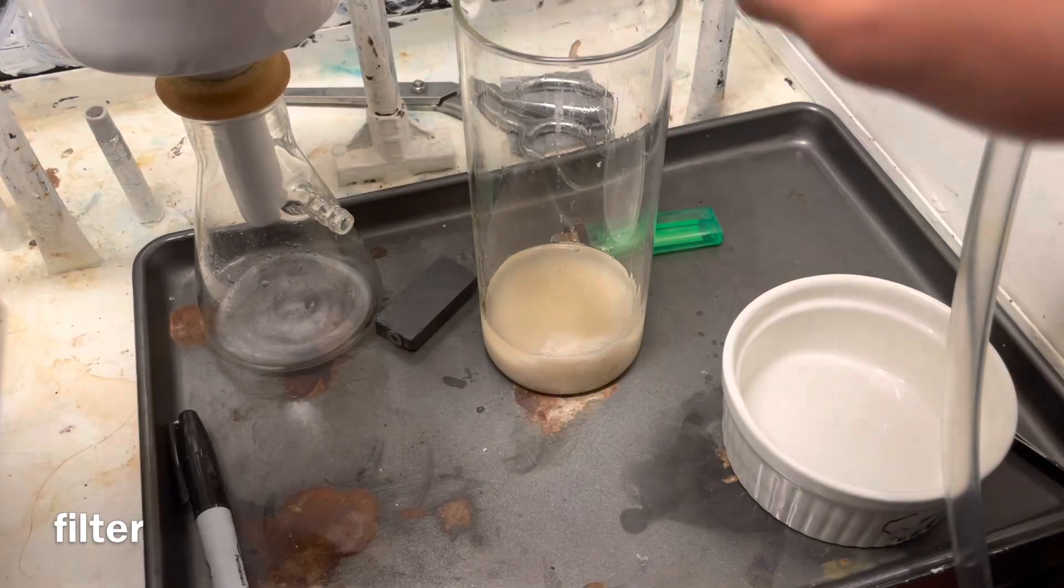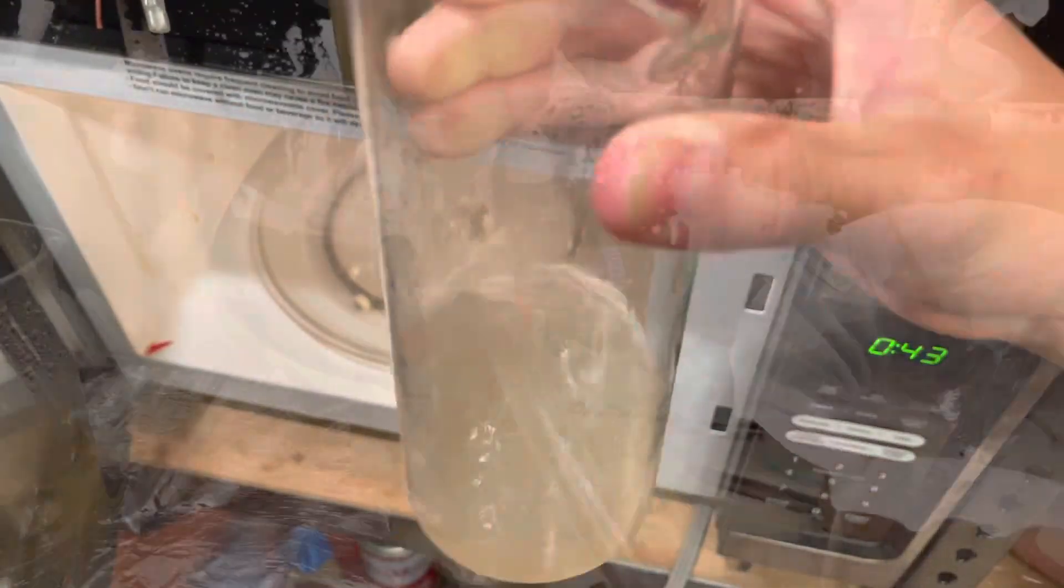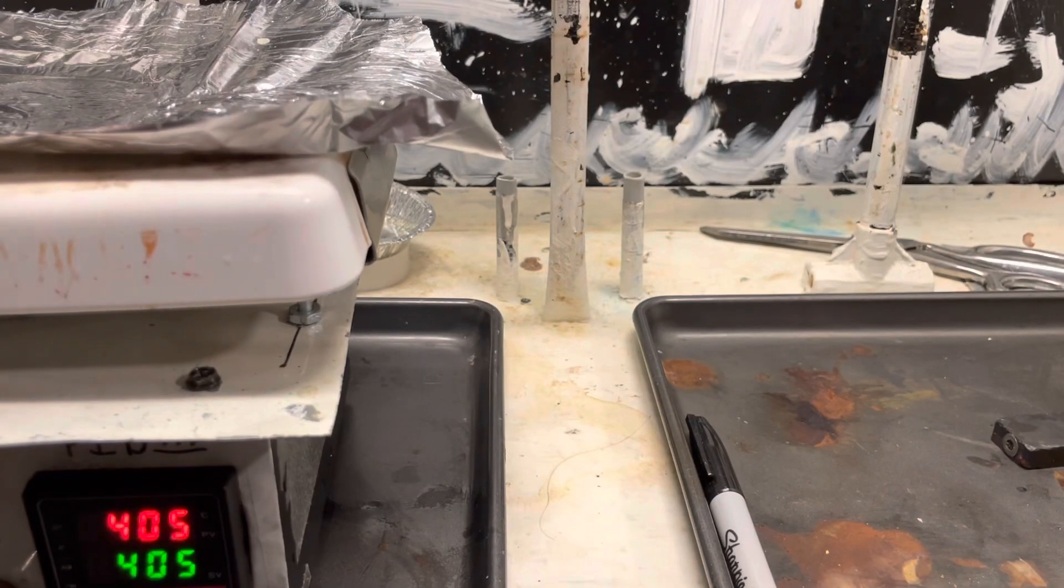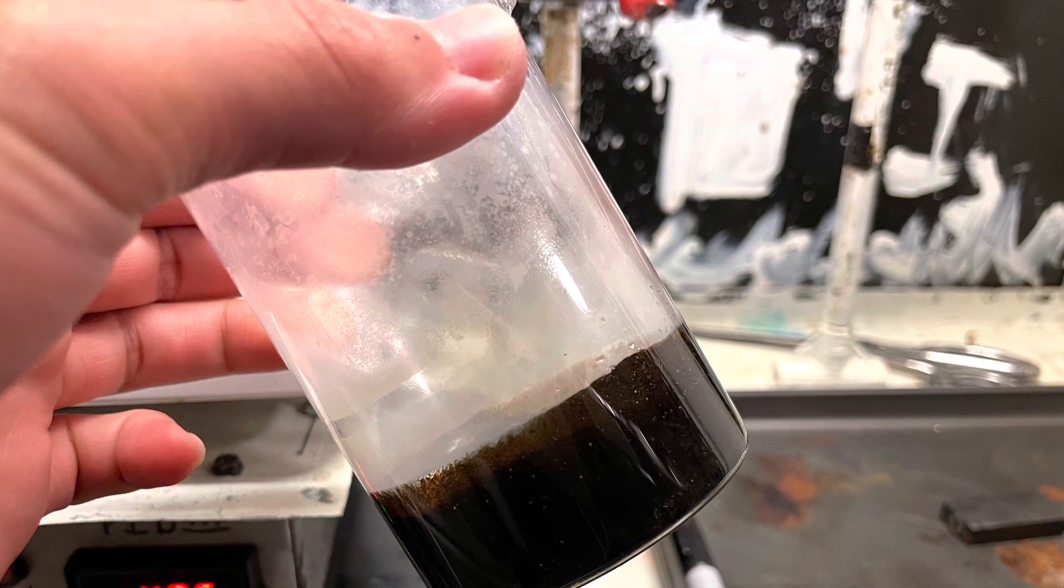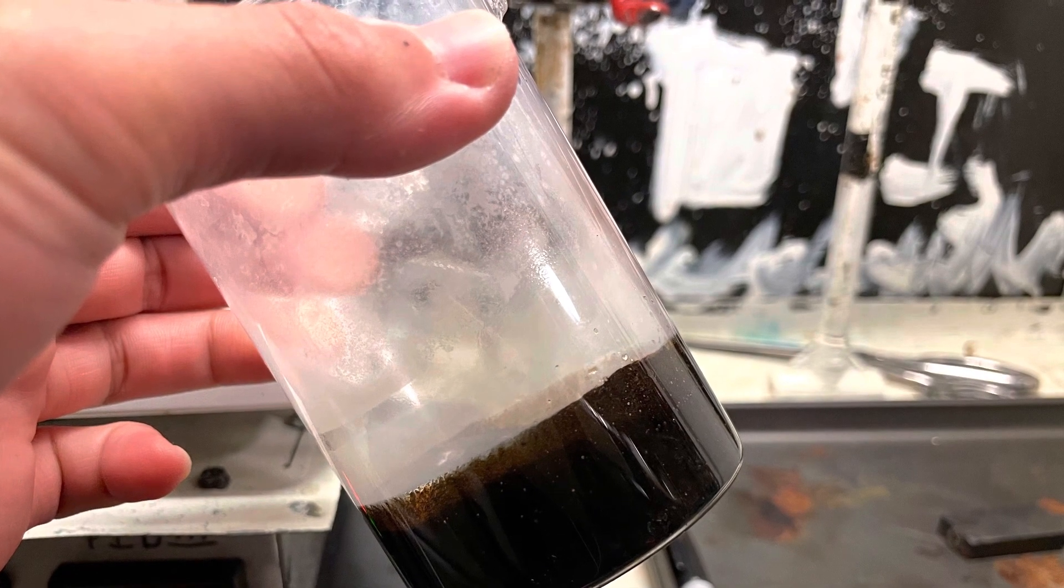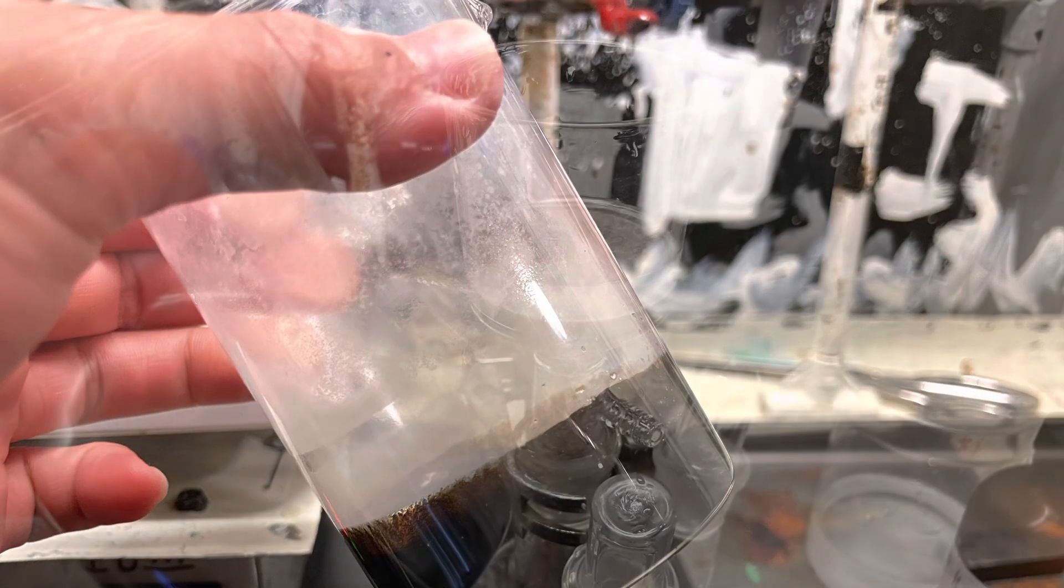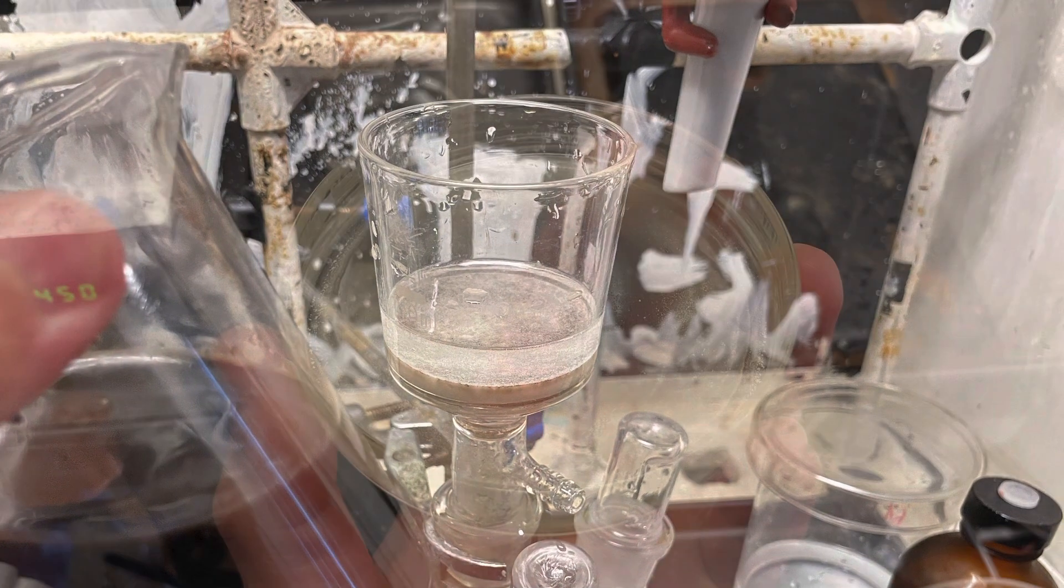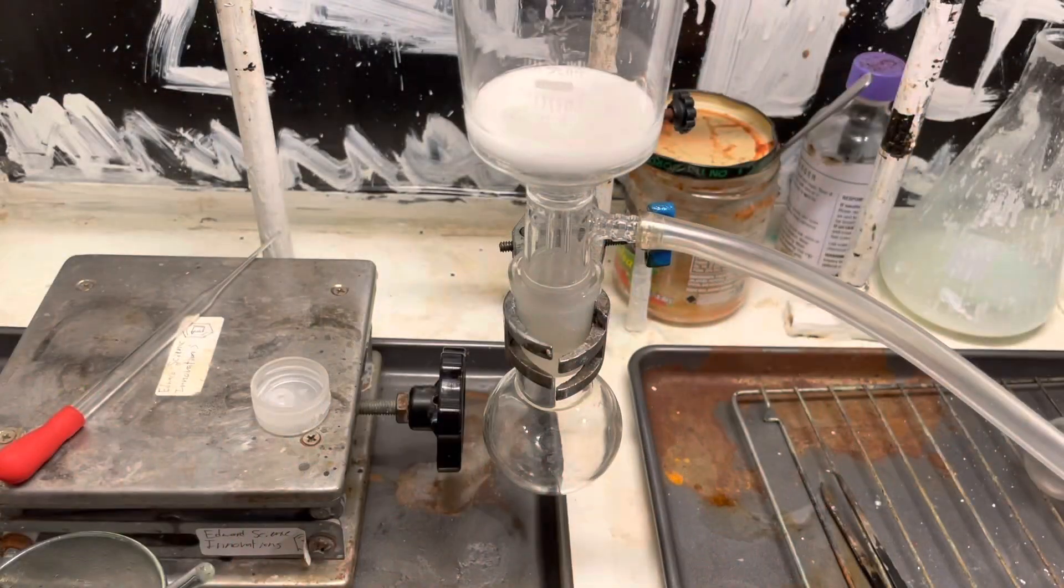We filtered this off now. And then, we're going to add some isopropanol, bring it up to a boil, and filter it. And now take your previous batch of crude crystals, and put that in boiling isopropanol as well, and filter it as well. And here you can see what happened after I tried to boil down the filtrate, and I boiled it for too long, and it charred. But I did extract it with some ether and sodium hydroxide, and I evaporate it down, and I did get a thin film of crystals on a beaker, which smelled weird. Like fish, ammonia, amine, and semen. I don't like it. But I'll probably try this again and isolate the pure hexamethylenediamine in the future, because I want to try some polymer chemistry with it.